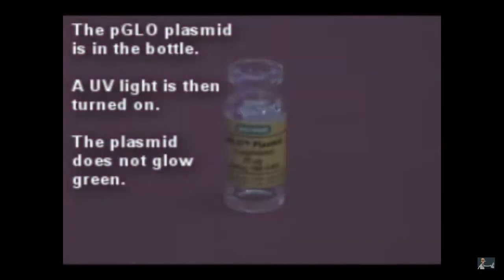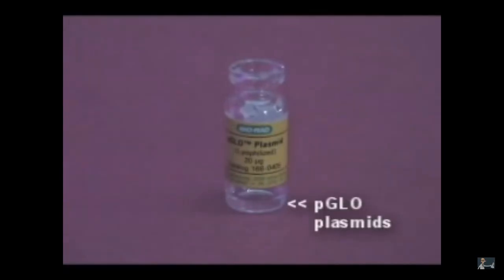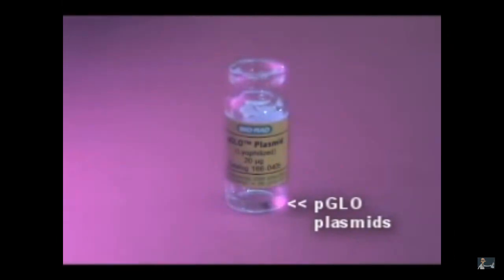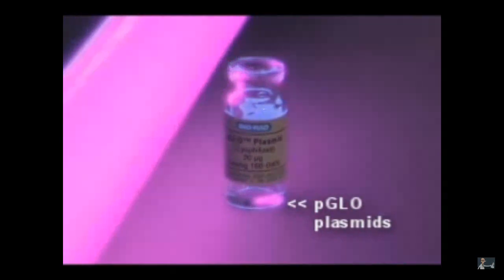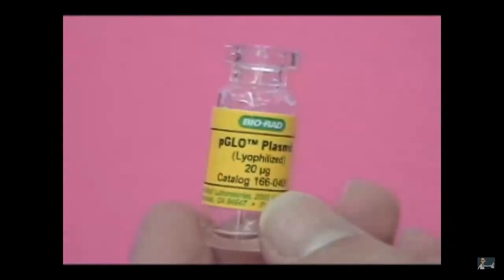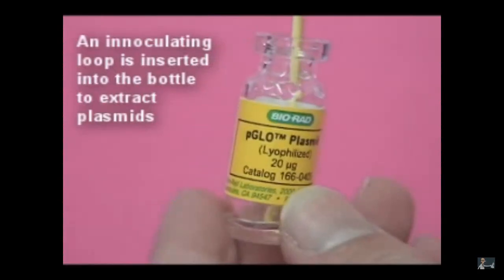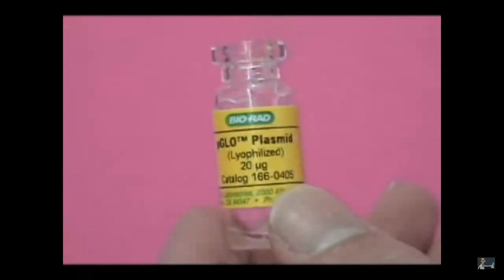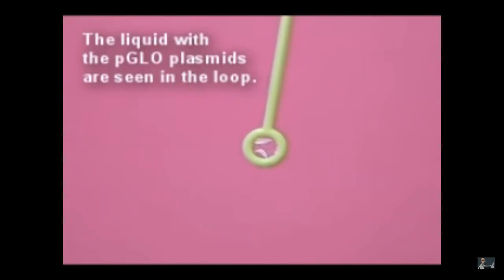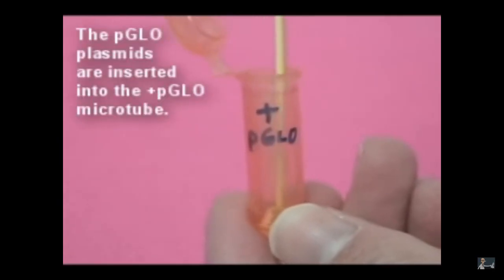Then you add plasmid, and they're just showing you that when you shine UV light on the plasmid solution, there is no fluorescent green because the DNA doesn't fluoresce, right? So a green fluorescent protein gene is not actually green. The protein made from it will fluoresce. Here they're adding the plasmid, but they're just using a loop to do it instead of a micropipetter. Only in the plus tube.